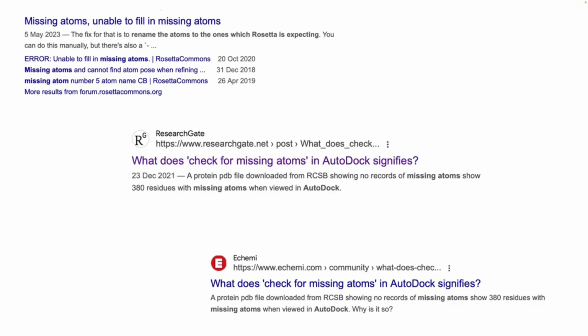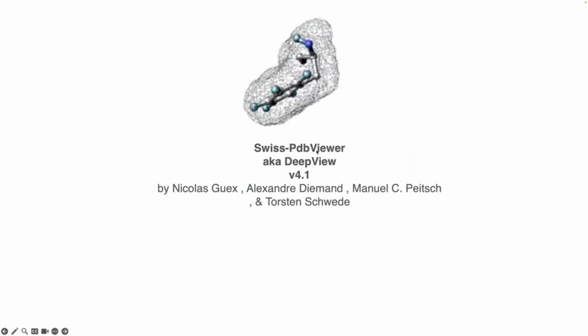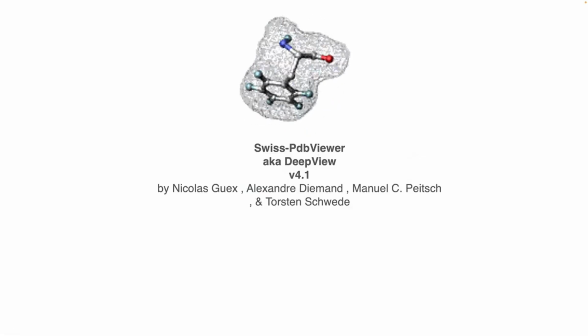You might have seen these prompts when you try to open a PDB file in MGL Tools in preparation for molecular docking analysis in AutoDock or AutoDock Vina. The solution is Swiss PDB Viewer. I mean, this is the most underrated tool that nobody cares about.